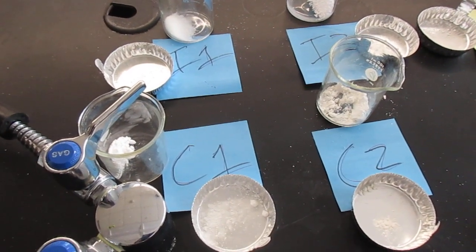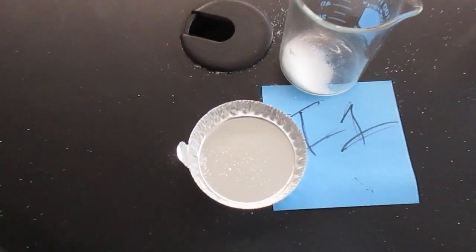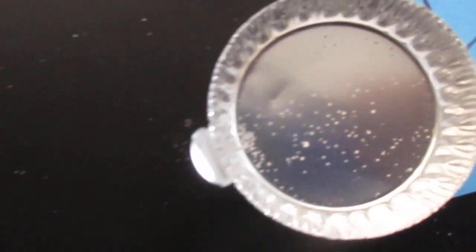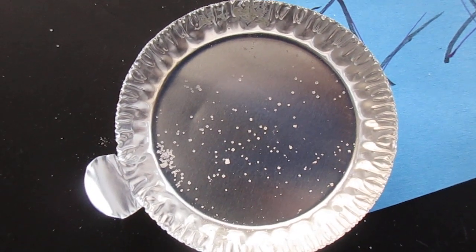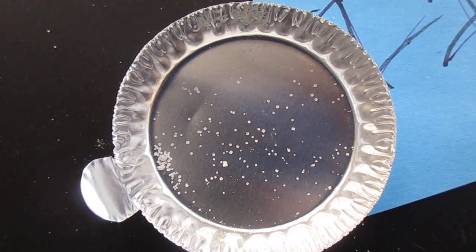Welcome to the first test, the structure test. Before we look at it in a microscope, I just wanted to show you, as zoomed as I can get on my camera, what it looks like.